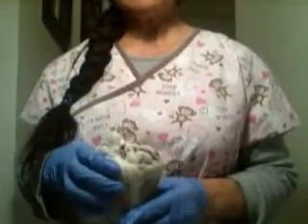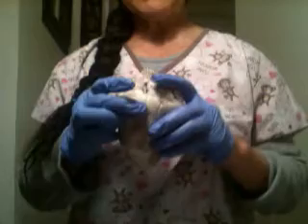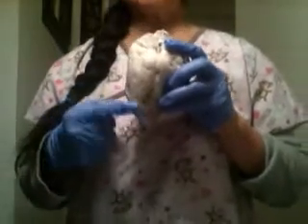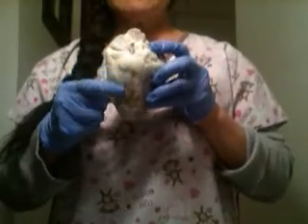And the interventricular sulcus has a major blood vessel found in the sulcus. It's a major branch of the left coronary artery, which is covered with fat, you can see, but the coronary artery runs around here.